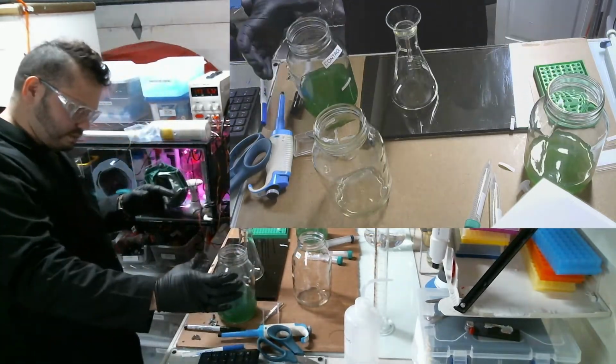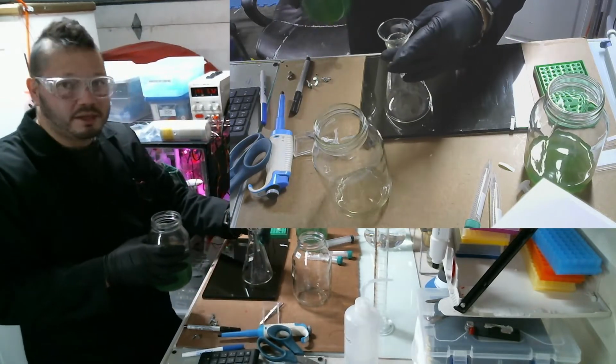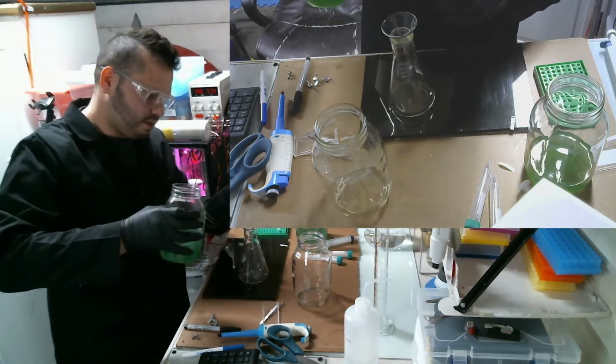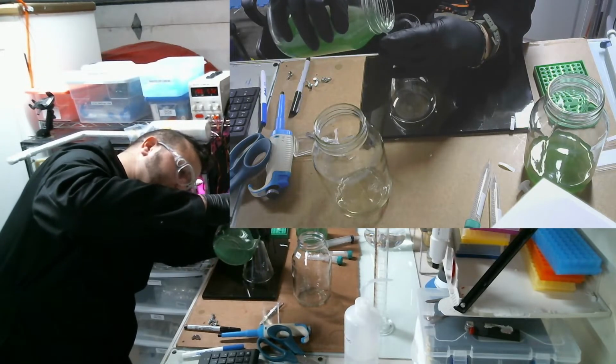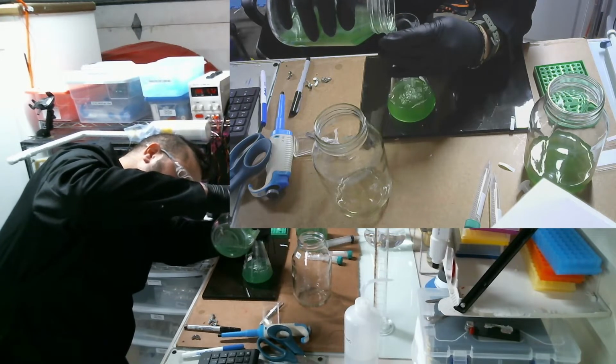Obviously, there's always some kind of error with measurements, but the important thing is to understand where your errors are. That way you can report them properly when you report your findings. It's impossible to not have any errors. You just have to understand them and understand whether those errors are enough to make your results significant or insignificant.